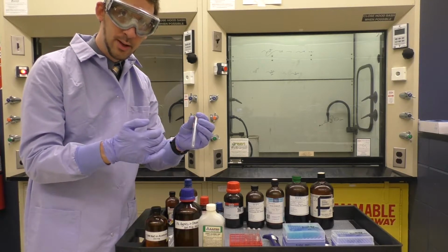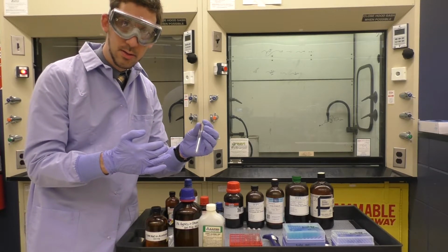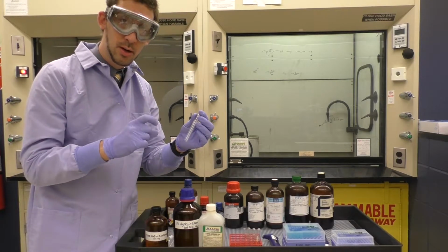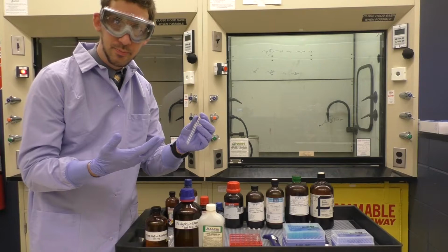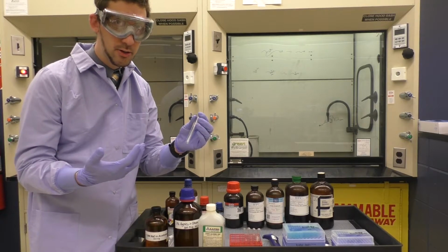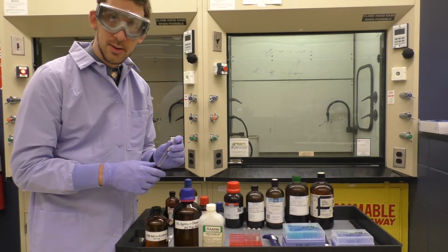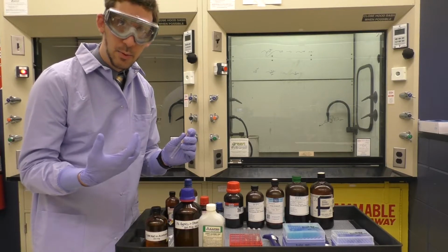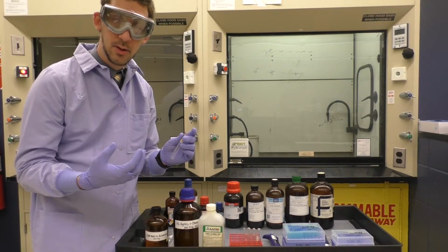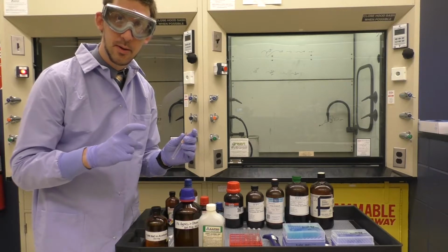And as soon as I dispense substrate, I'm going to start a timer and look for the formation of a precipitate. Look for the solution to get cloudy. Not necessarily a color change, because some of my substrates may be colored, but I'm looking for the formation of a precipitate. So it starts to get cloudy or stuff immediately crashes out. And I simply want to measure the time that it requires before a precipitate forms.